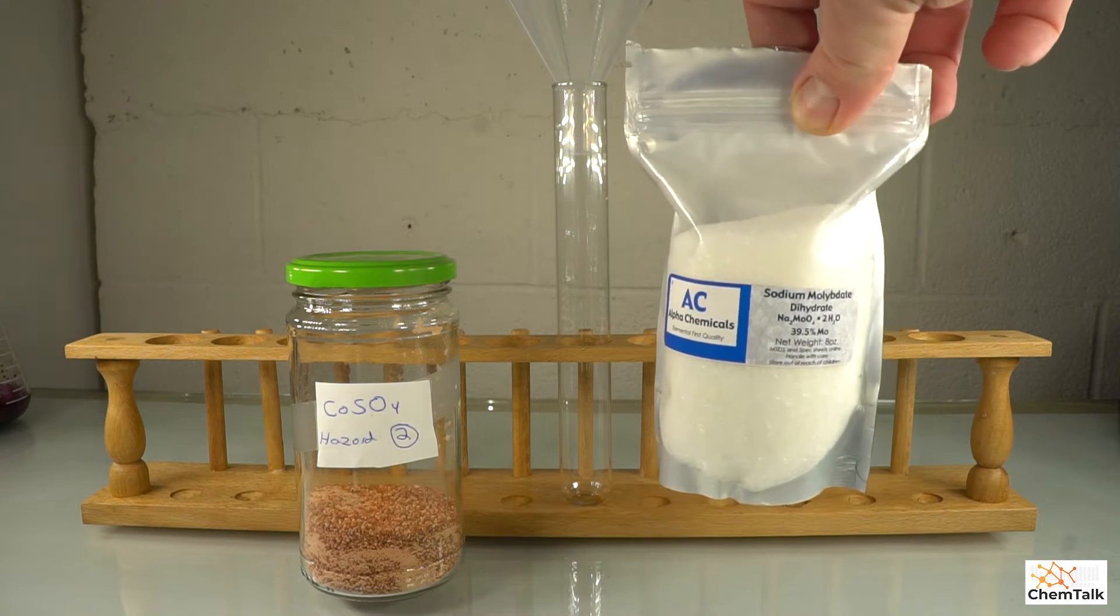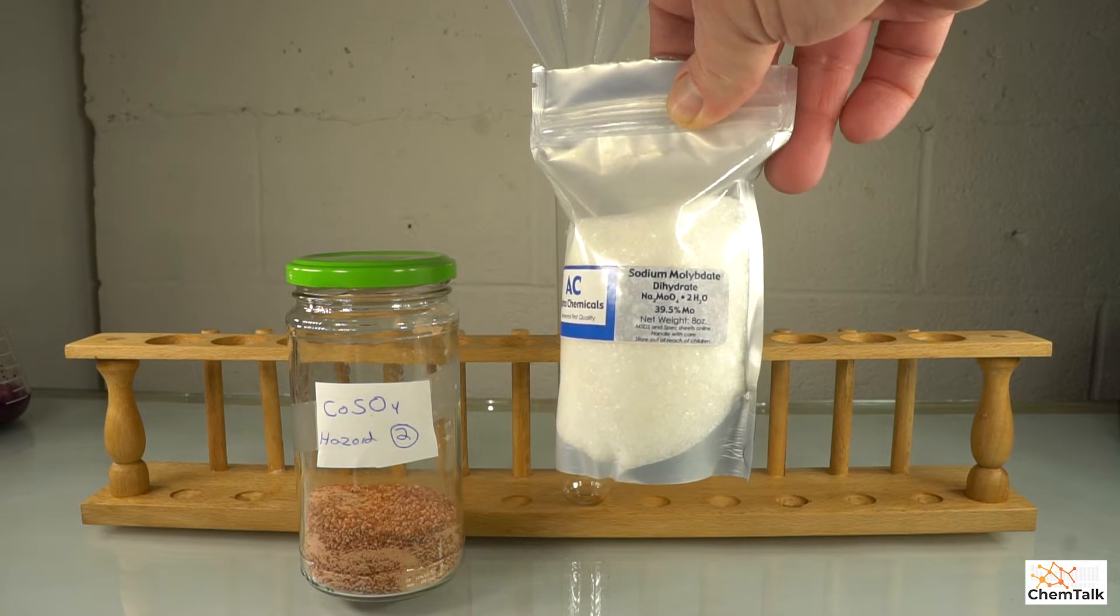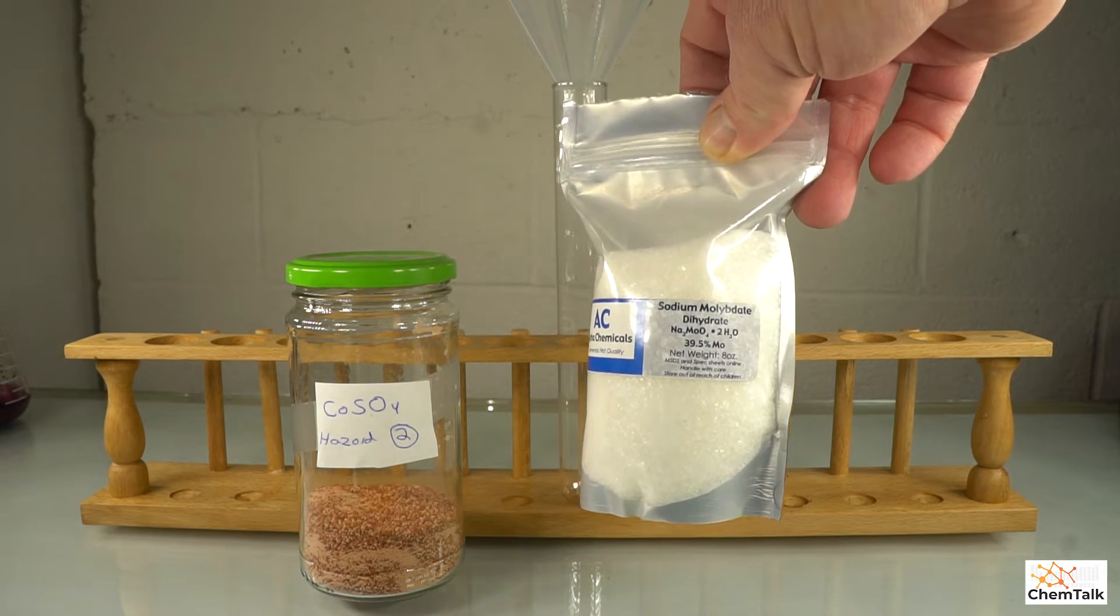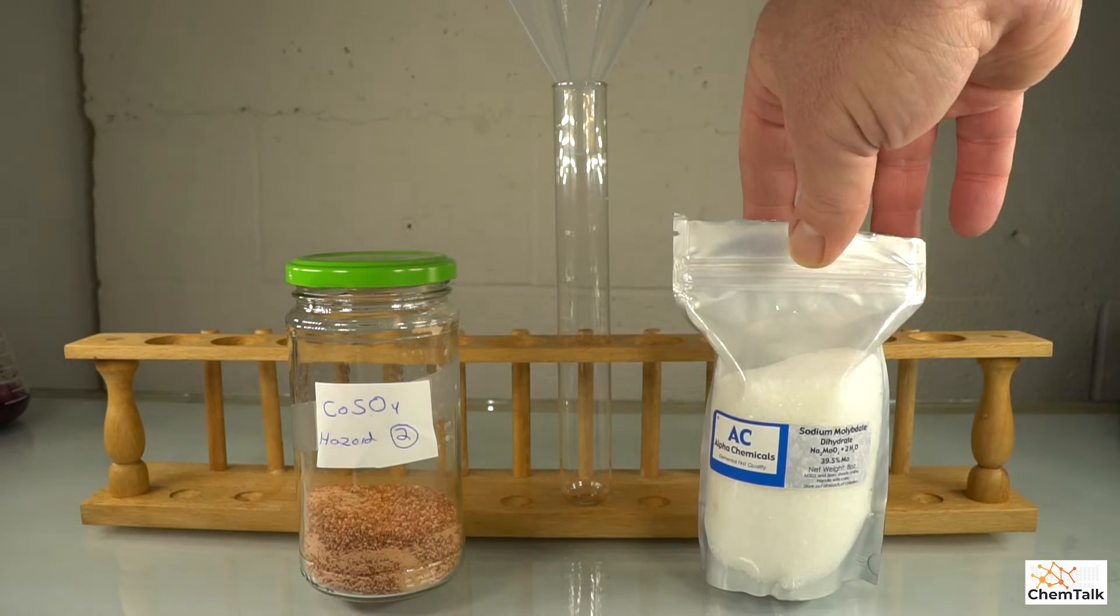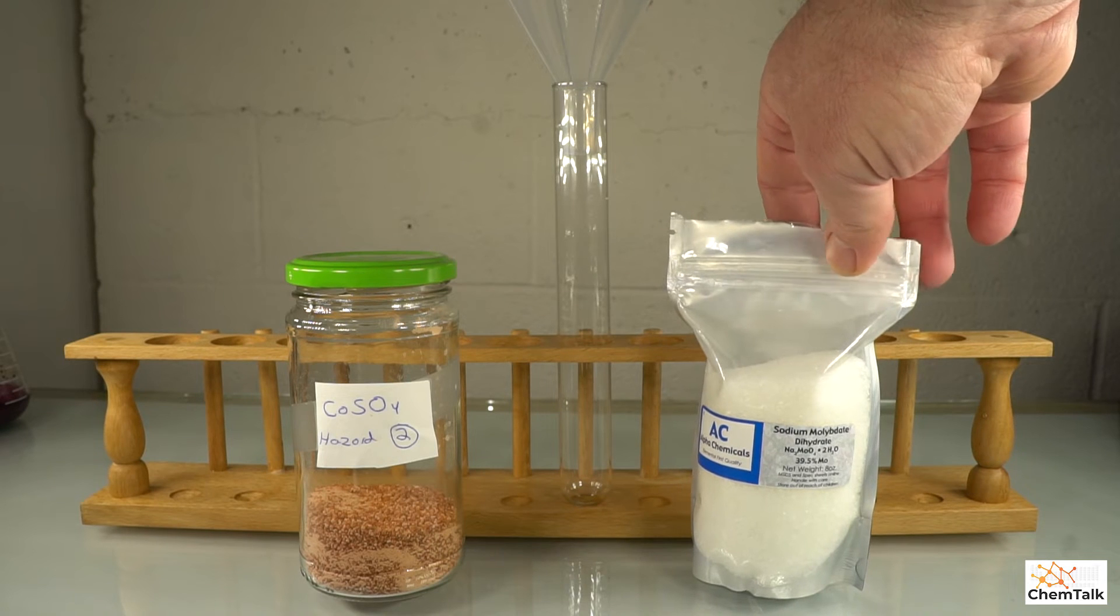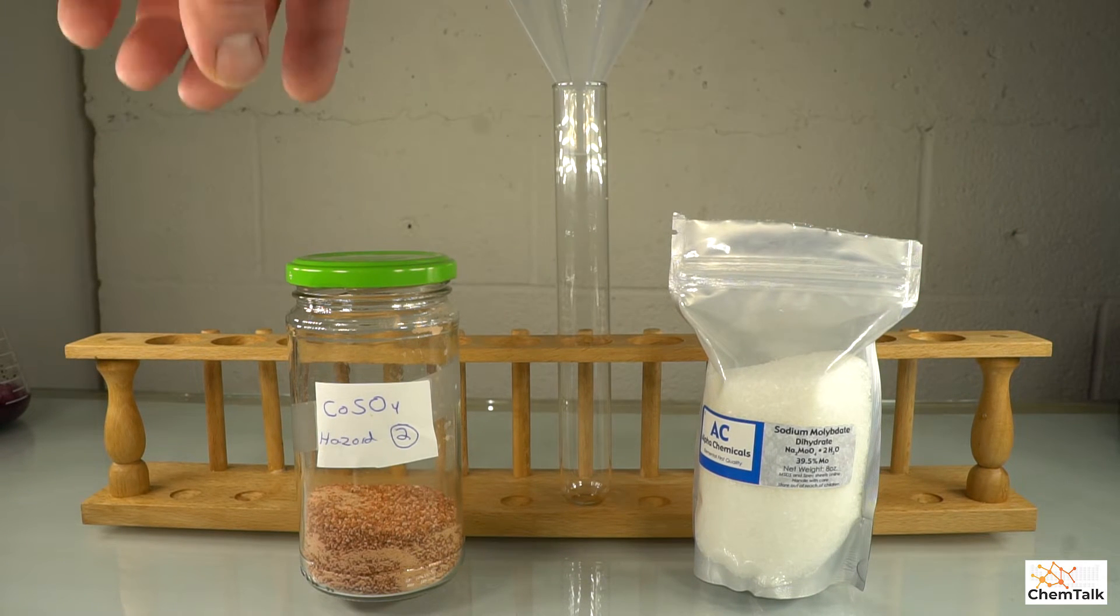So here is some sodium molybdate dihydrate. It's a compound with sodium and molybdenum in it. It's quite soluble in water, and it's really a great compound for reactions.